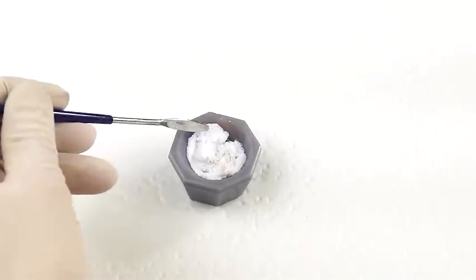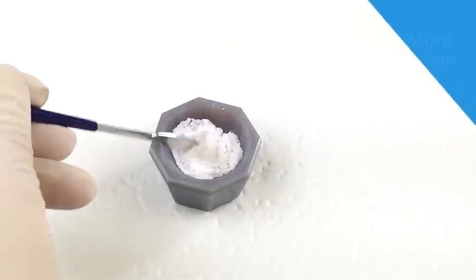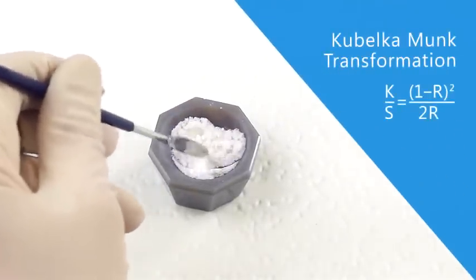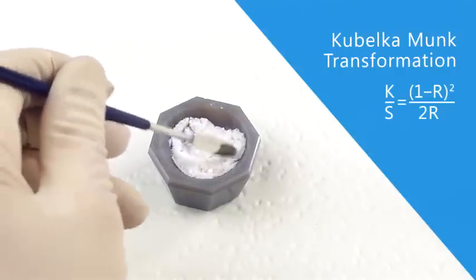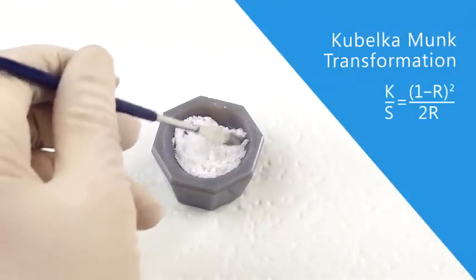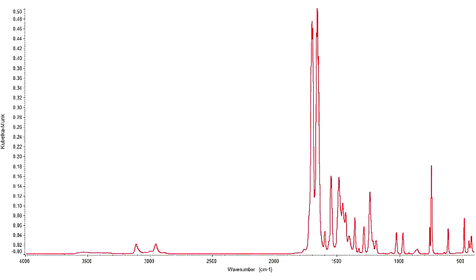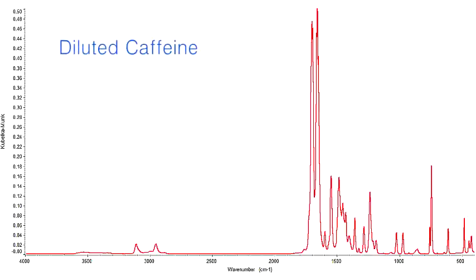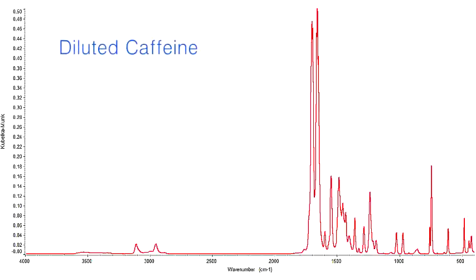To show the effects of proper diluting, caffeine is mixed with KBR at a concentration of two percent. After applying the Kubelka-Munk transformation to linearize the data, the spectrum appears to be more similar to a transmission spectrum and clearly exhibits higher spectral quality.